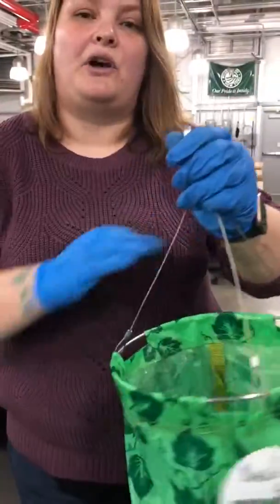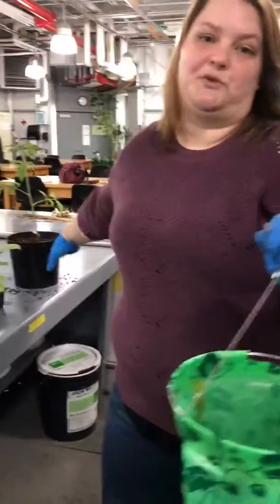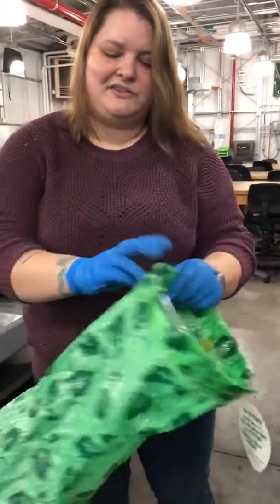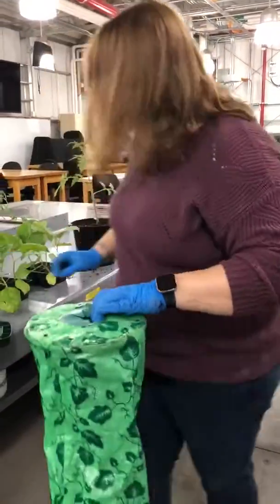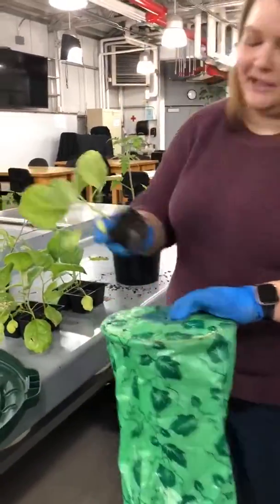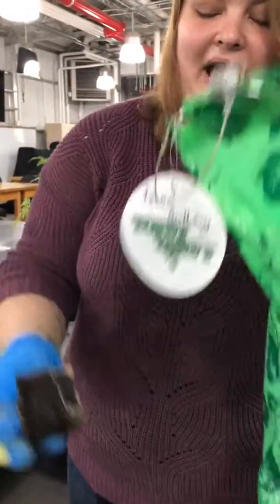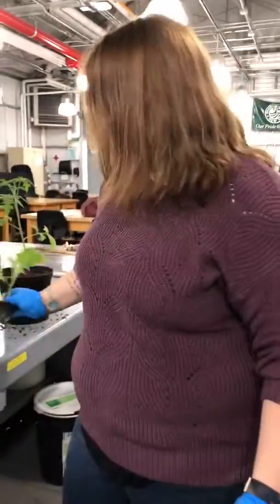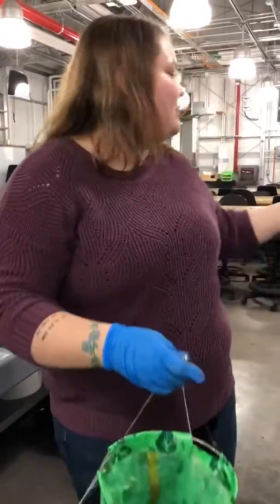So we will be hanging this up in greenhouse 3 across the beams that have automatic irrigation on them, and then these normal pots will be on the bench below. So there's kind of 2 ways you can start with this. If you were to grab your plug and place it in here, then when you're filling it up with soil, you'd have to hold on to it because you can't rest it against the bench, or you'd snap your plant in half. So I tend to just fill this up with our potting mix first, and then put the plug in.